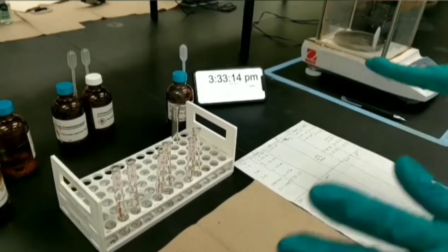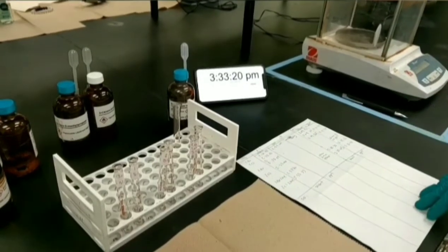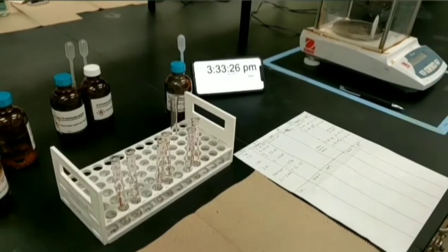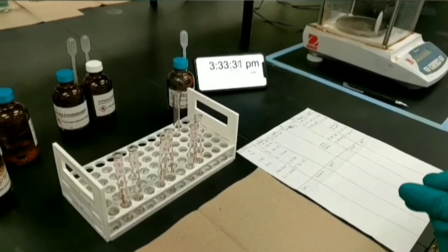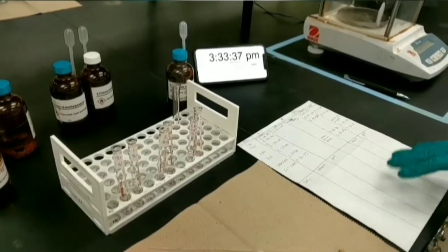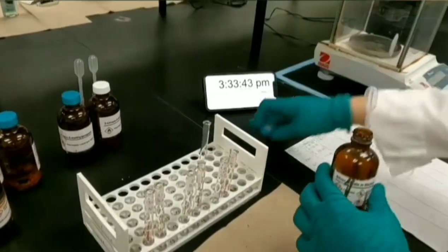After adding nucleophile to the test tubes of alkyl halides, you need to record the time as a starting time of reaction. And after getting any precipitation, you need to record the ending time of the reaction. First, we need to try the reactions in room temperature. If we cannot get any precipitation, we need to increase the temperature to 50 degrees centigrade of water bath. Let's get started adding nucleophile to alkyl halides.